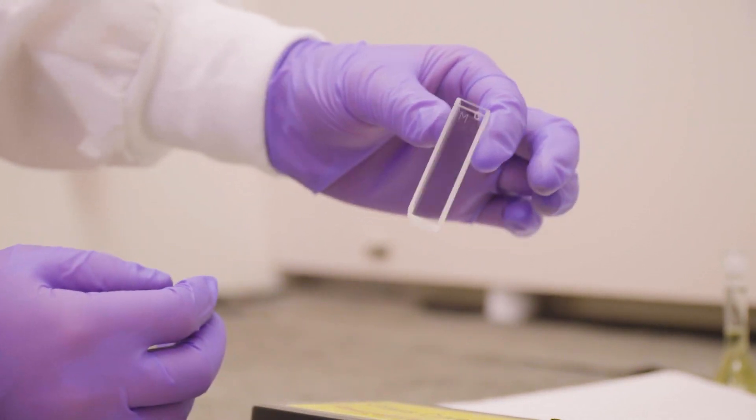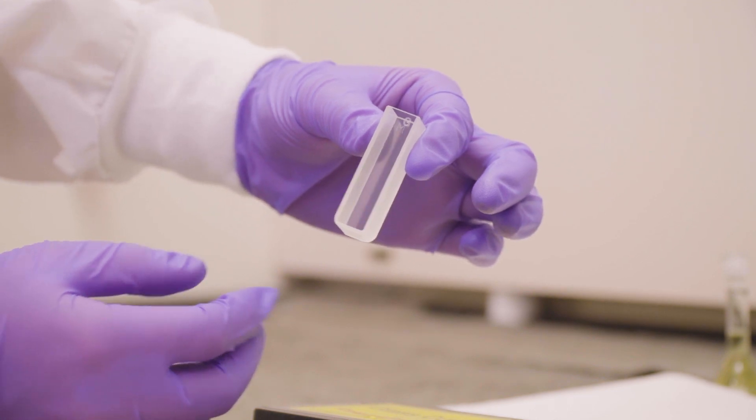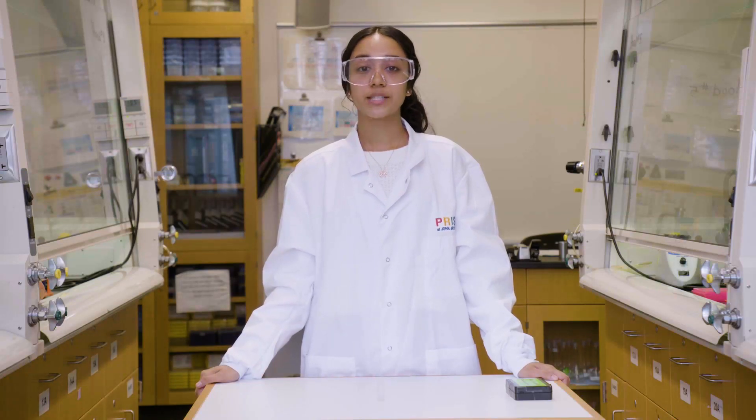When handling a cuvette, avoid touching the clear sides to prevent fingerprints or water droplets which can scatter the light. Always hold a cuvette by its frosted sides.